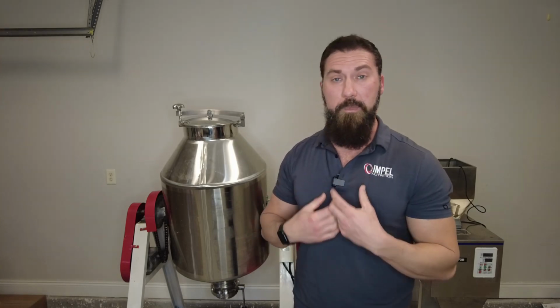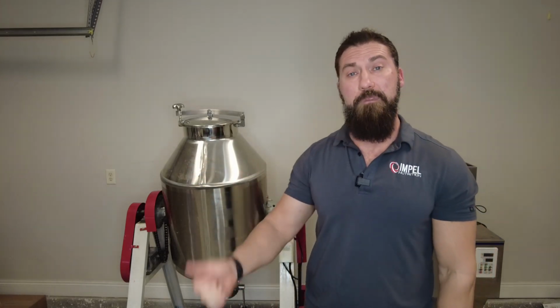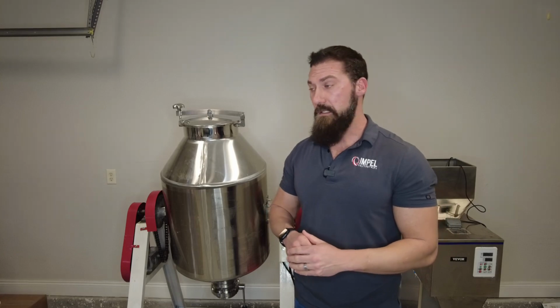Once we are mixing, we have to confirm that the mixture is done properly. Okay, you guys know me. Third-party lab testing is very important to me. So when we get into this point, we have to think about how we are going to verify that we do have a homogeneous mix. So there's a few ways that you can sample from this batch, right?